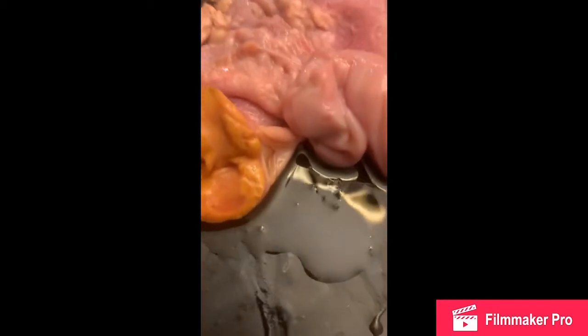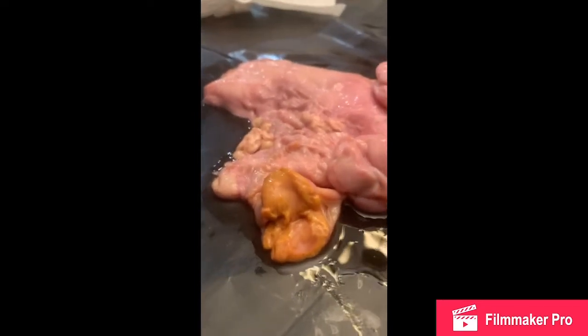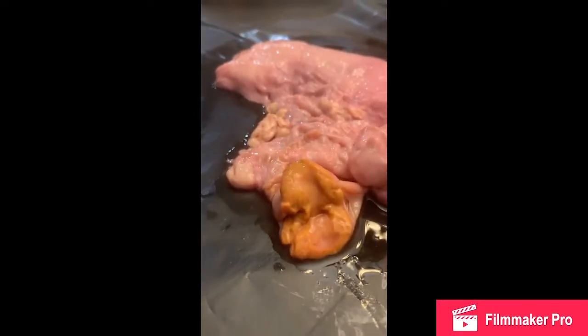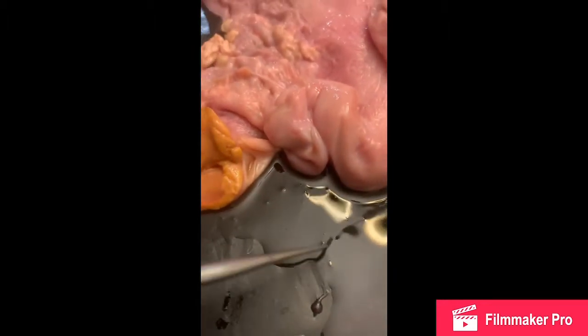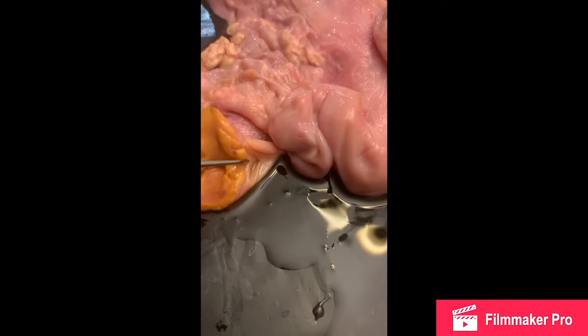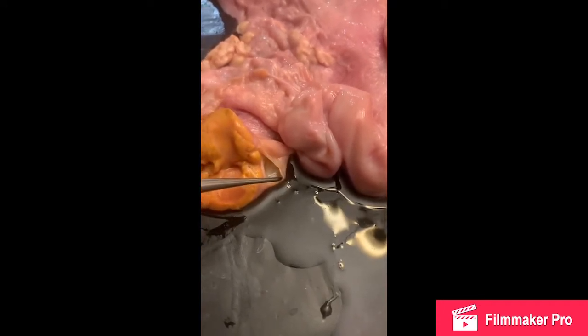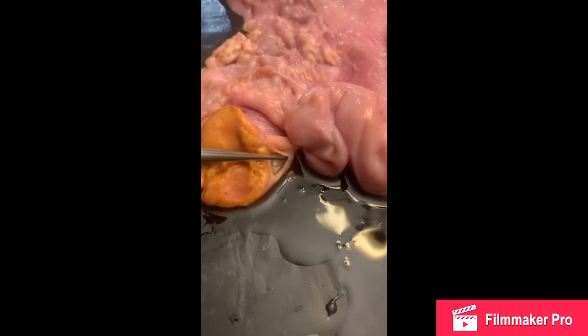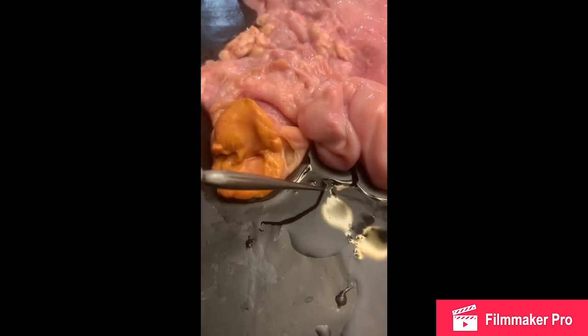And we can see here, once we have opened the ovary, that it is quite filled with our corpus luteum on the outside here, as well as the opening of our follicle, which produced some of that fluid there. This is where our granulosa cells would be. You can see it's a thin membrane where it once was.